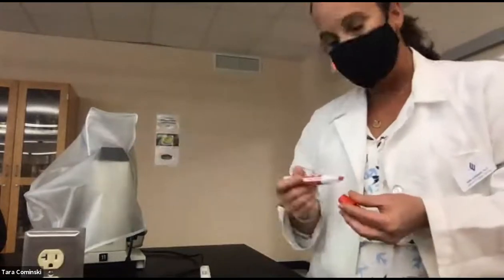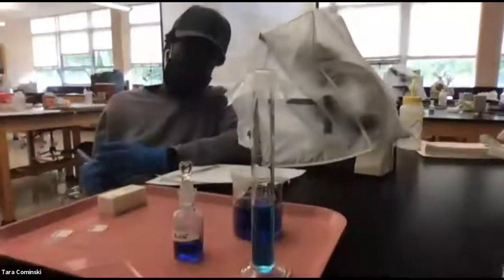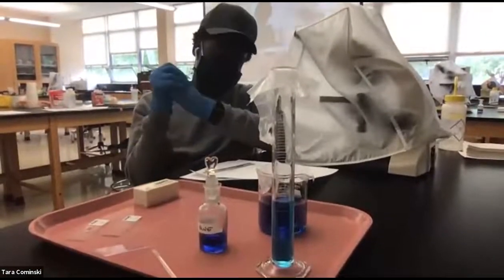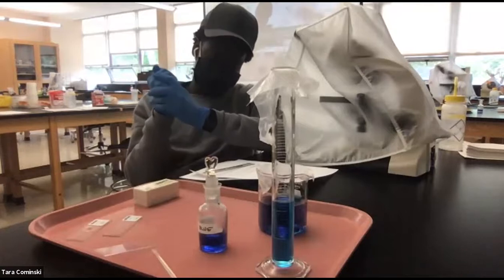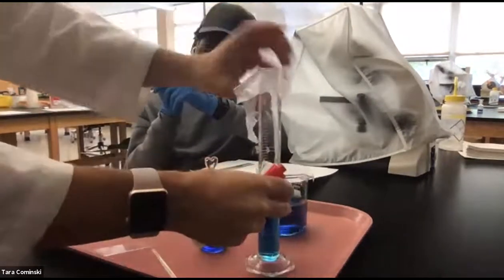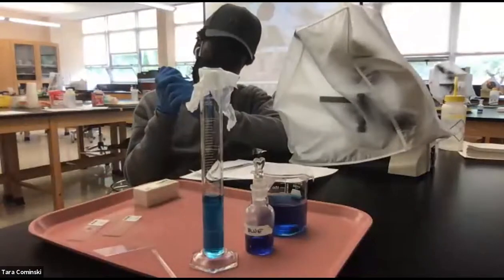So you guys have a beaker and a graduated cylinder in front of you there, right? You can use that as my point of view there. So both of you, the first question asked you about the graduated cylinder, right? What's the volume? So basically we're just going to measure the volume in that graduated cylinder. How do you measure the volume in that graduated cylinder?